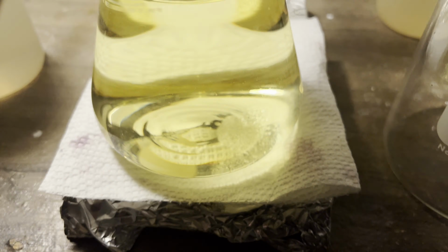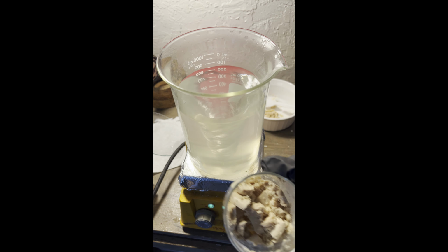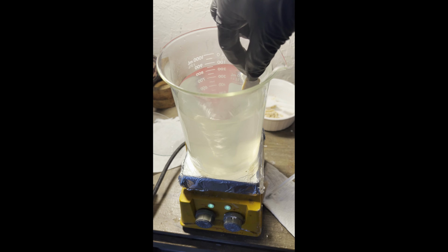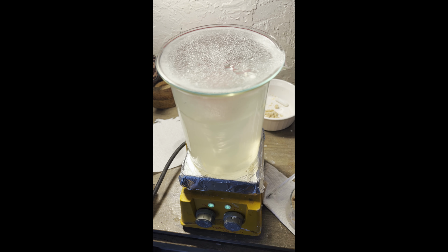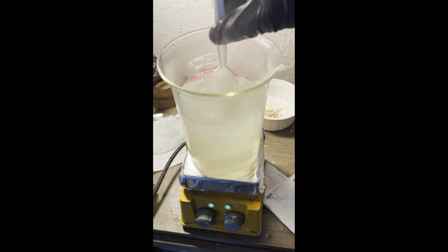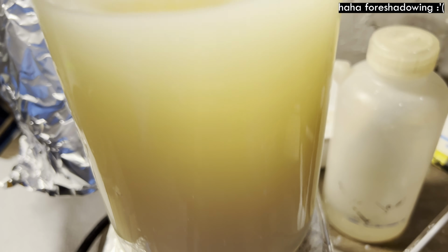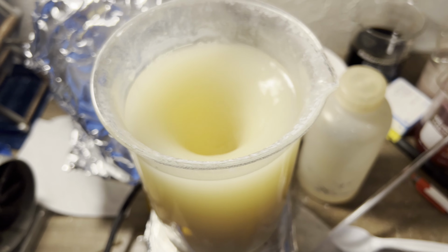I decided to demonstrate how differences in rates of cooling of solutions in recrystallization affects the crystal formation. Fast cooling gives smaller crystals, slow cooling gives larger crystals. If I hadn't already lost so much product over the course of the reactions up until now, I would have filtered the solutions hot because they weren't clear, since that bothers me. I was too resigned at this point to do it.